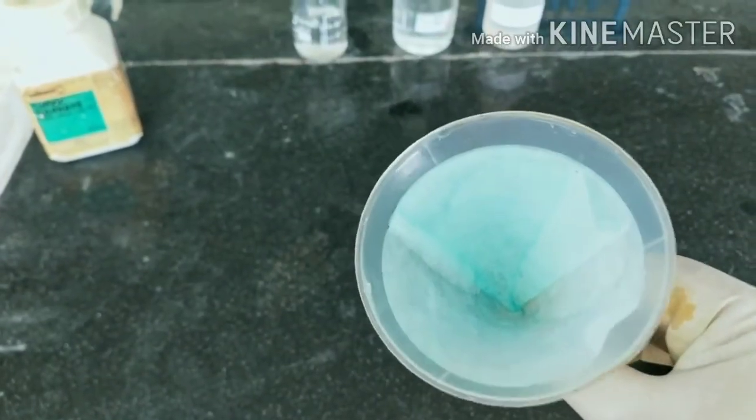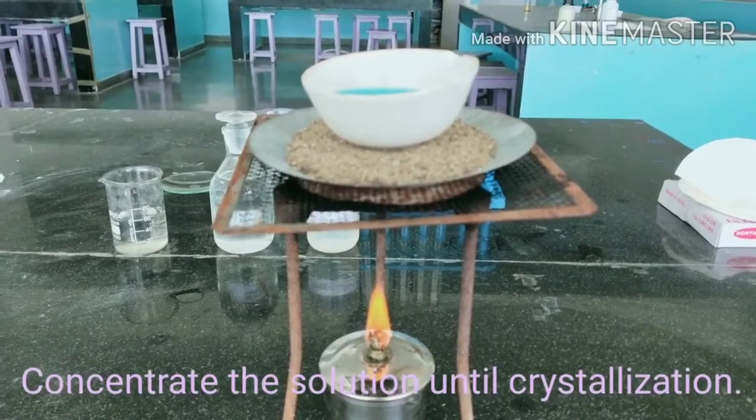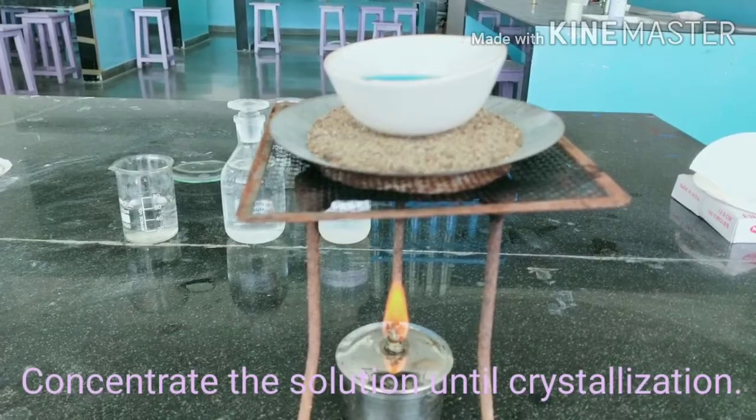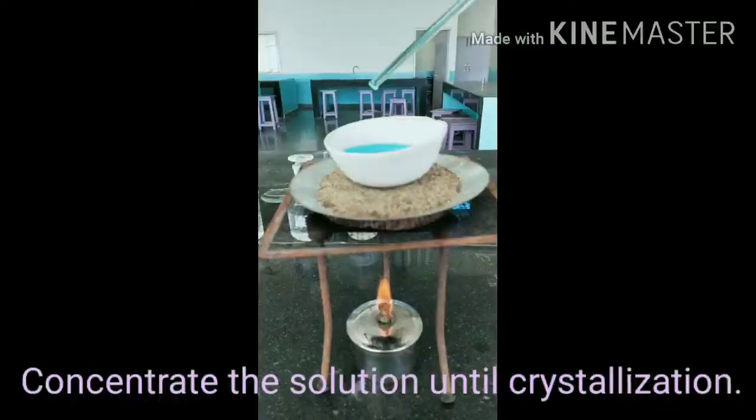The impurities will remain in the filter paper and the filtered copper sulphate solution is kept on the sand bath for the crystallization process.